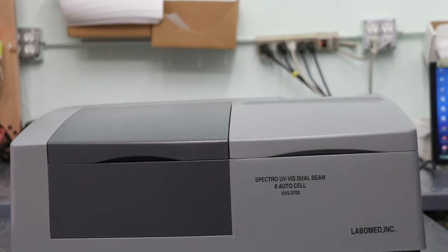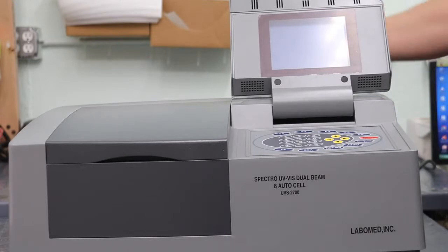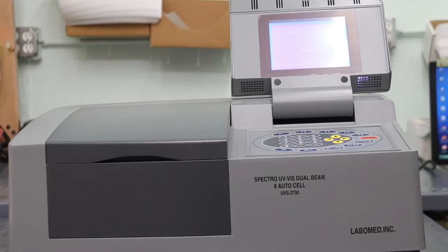When your unit has been unpacked, simply open the top and turn on the rear power. This will run the self-test initialization.